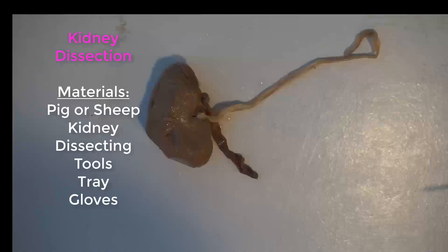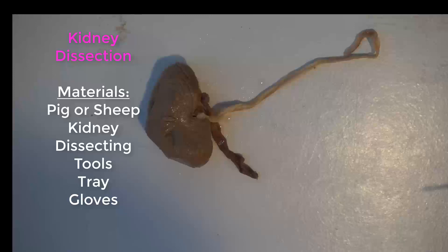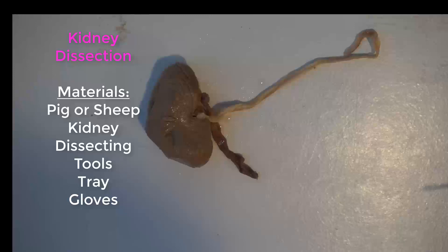For today's kidney dissection lab, you'll need a pig or sheep kidney, dissecting tools, a tray, and gloves.